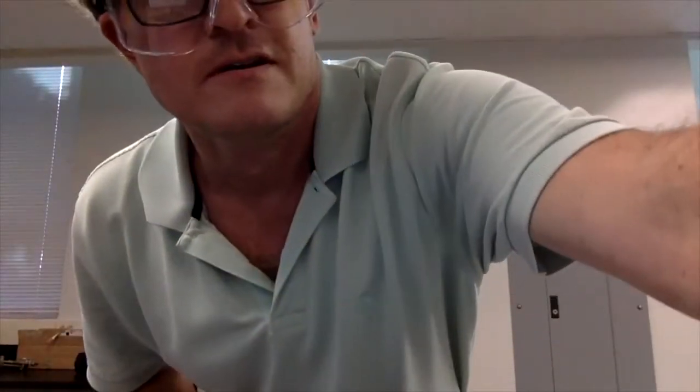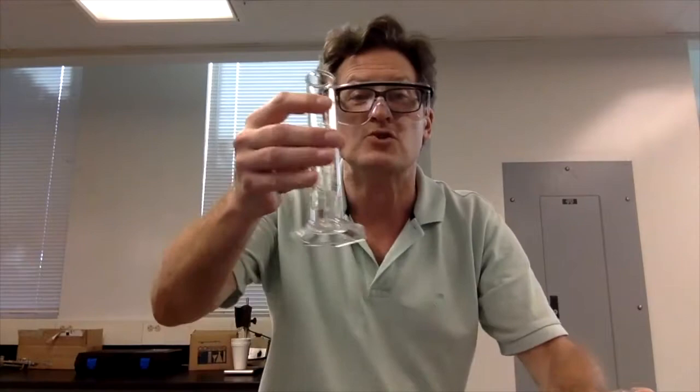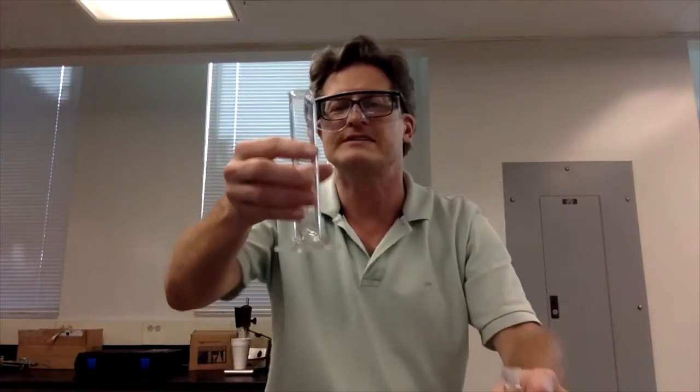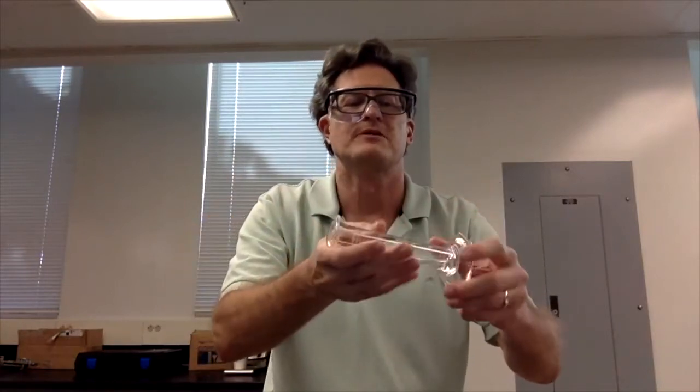And so we're going to wash out our glassware, and to make sure that we get the right conductivity, we want to rinse it with the solution that we have, right, that we're going to measure with. So it's a good idea to rinse that, right? Make sure we rinse that, get all of that to be the solution and only the solution that we want.